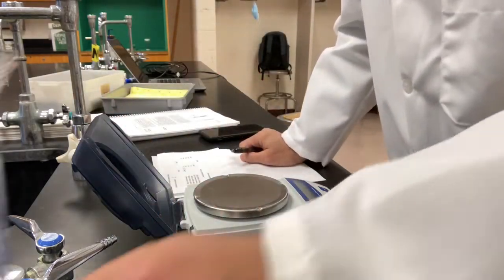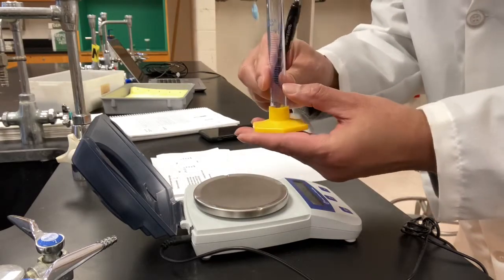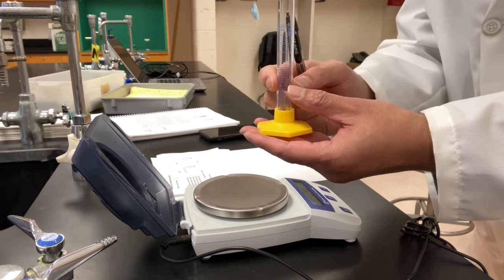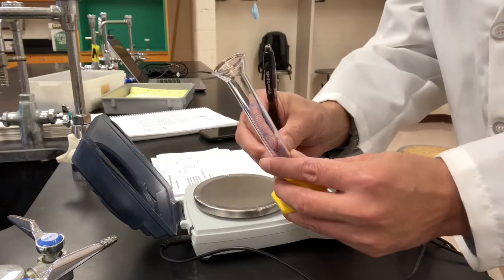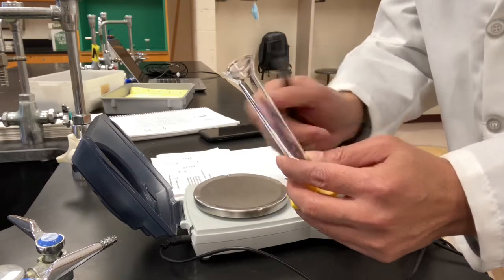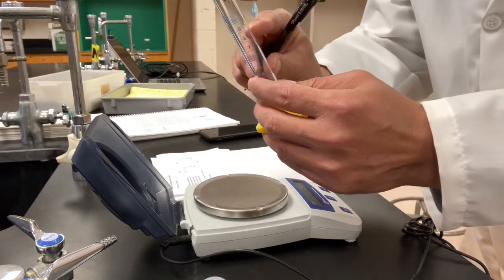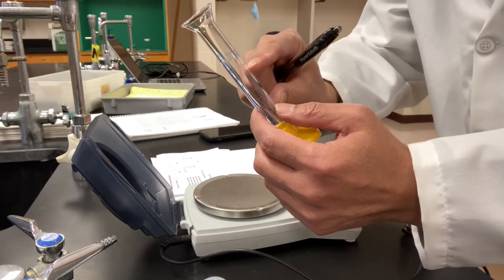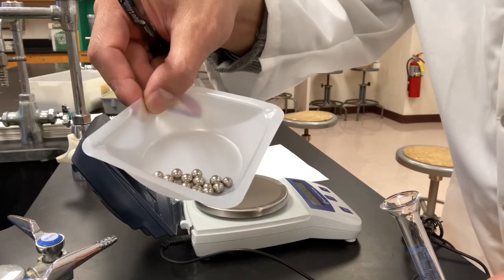We're going to use a graduated cylinder. We're going to add some water into it first and take a record of the volume of the water added. Then we add the metal beads into it. When you add the metal beads, the water surface is going to rise because some of the volume is going to be occupied by these metal beads. Once we add in all the metal beads, we read the volume on top of the water again. The difference of the two volume readings will be the volume of the beads. I hope that makes sense to you.